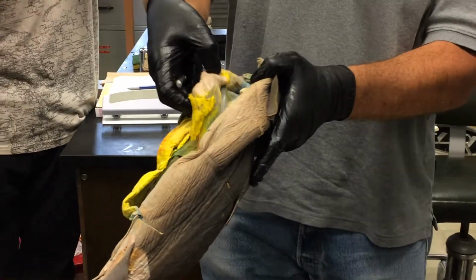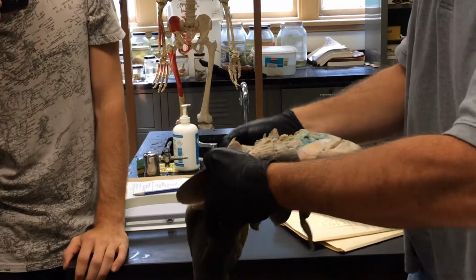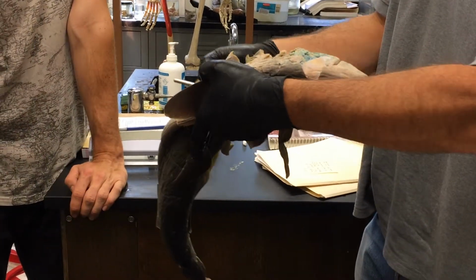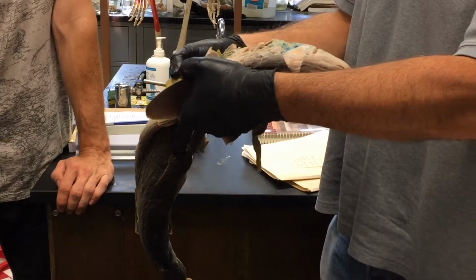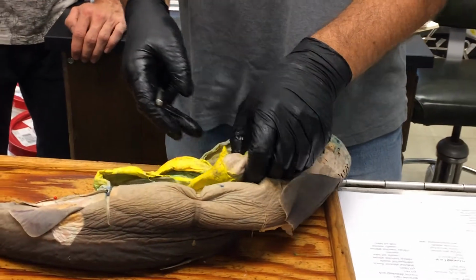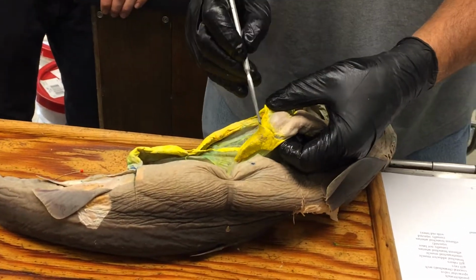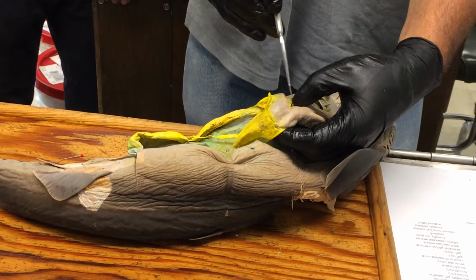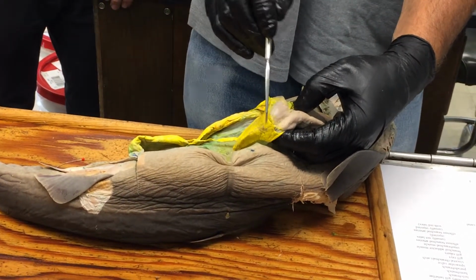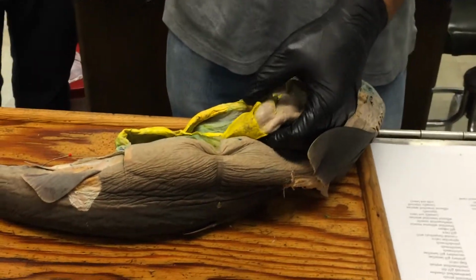And it's got different regions depending on what part of the gut it's attaching to. So the part that connects to the stomach that I'm showing you here is called the mesogaster or greater omentum. Okay. Gaster, the root for stomach. There's a little tiny part of the dorsal mesentery that connects the spleen to the stomach, and that's called the gastrosplenic ligament, and it's just this little bit right in there. Kind of not that exciting, but there it is.